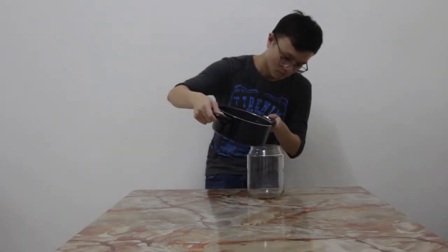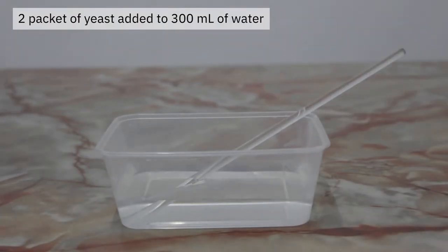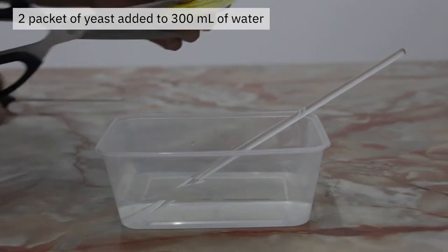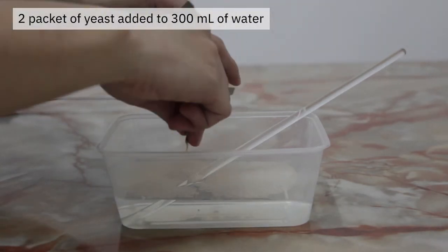The solution is then allowed to cool and transferred into a fermentation vessel. To another container with 300 ml of lukewarm water, 2 packets of yeast are added and stirred and then allowed to sit for 15 minutes.